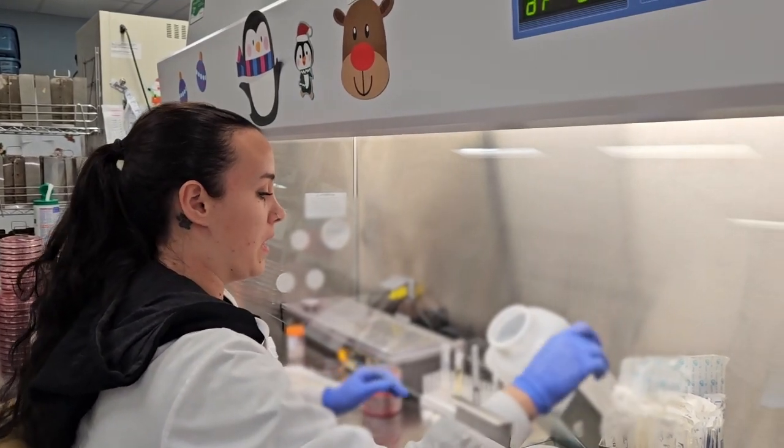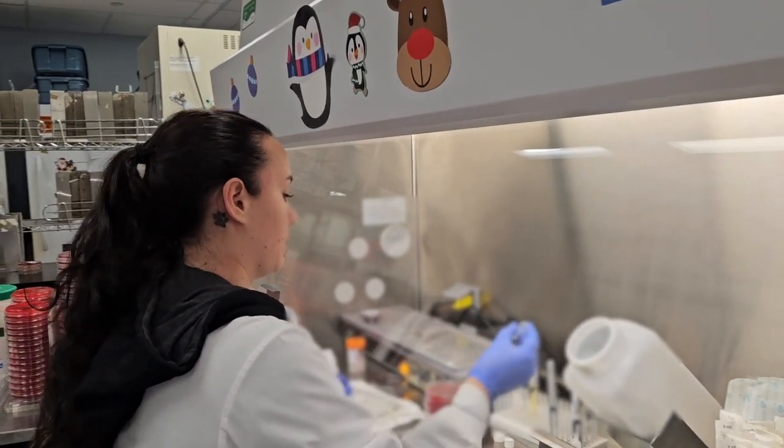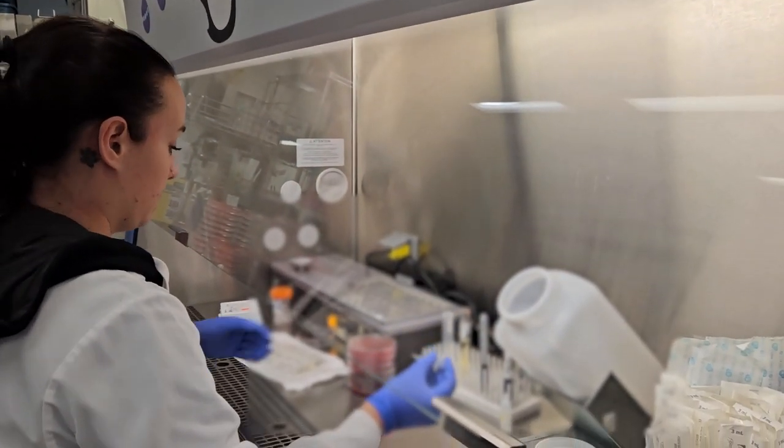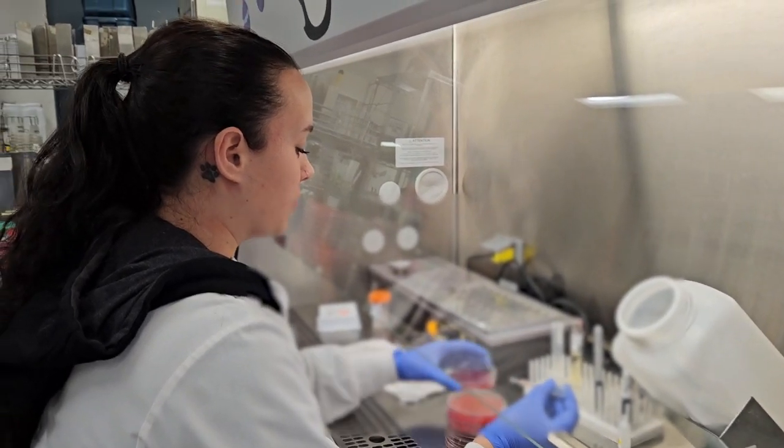Now I'm going to grab a syringe. Put one drop on each plate.